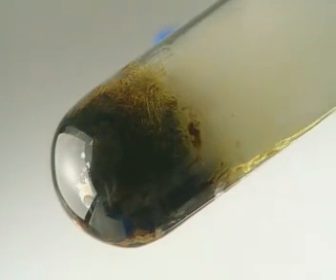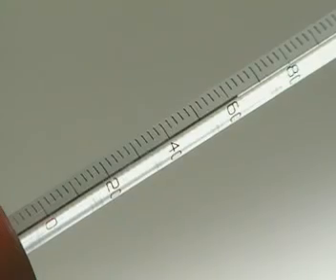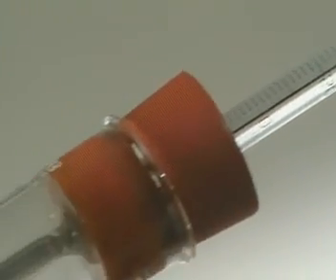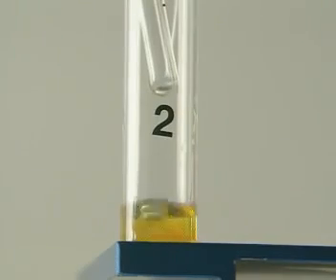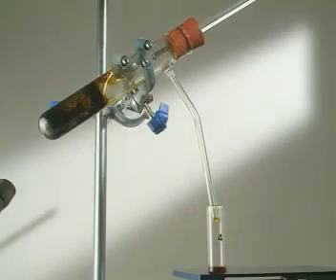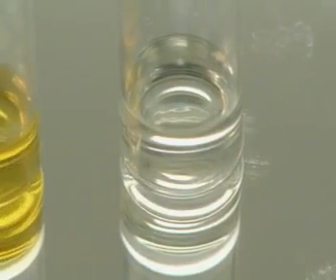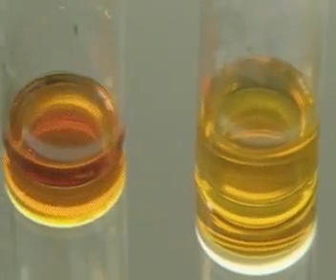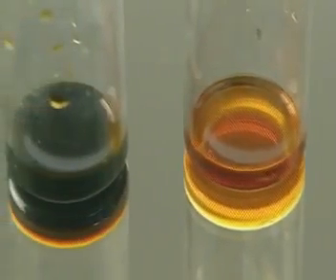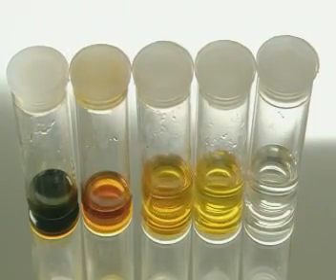As the temperature rises, other hydrocarbons begin to boil. A new fraction is collected at about 60 Celsius. It's slightly yellow in colour. And so the process continues. By carefully heating the oil and collecting the liquids which condense at a number of different temperatures, the many different hydrocarbons in crude oil can be separated. This is known as fractional distillation.